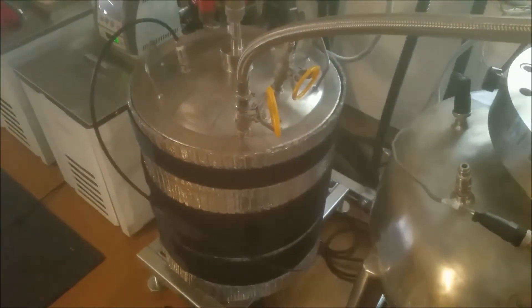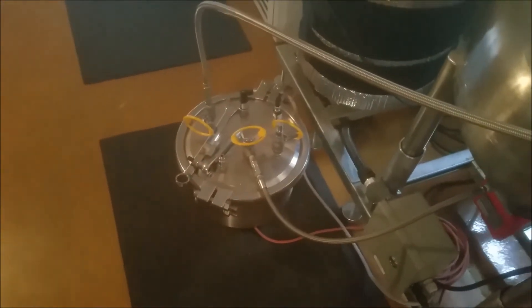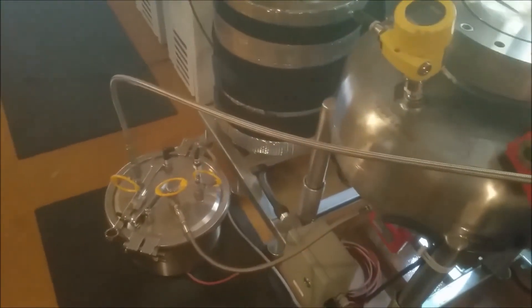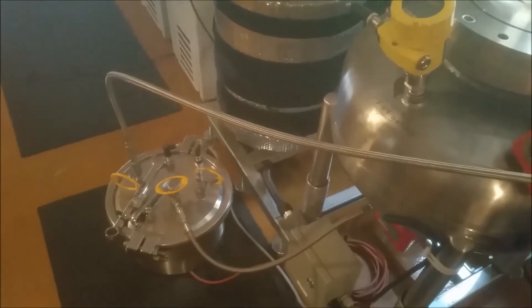This tank is not opened and neither is the solvent delivery tank. This is the recovery tank. The dryer tank is opened but the other tanks are not, so the only tanks I have to recover the solvent vapor pressure from are the dryer tank and columns.